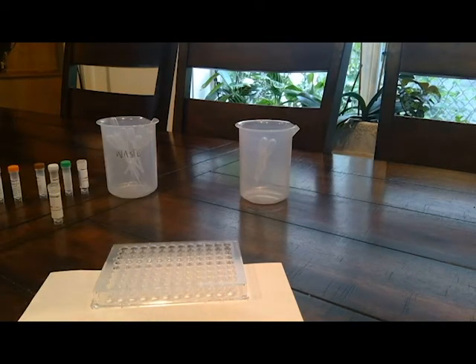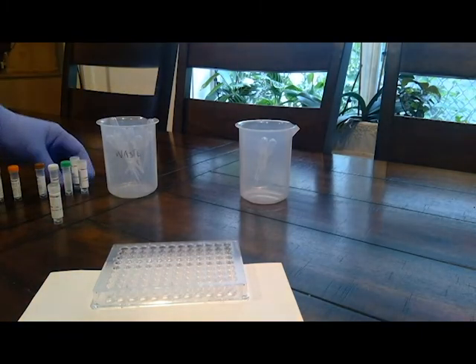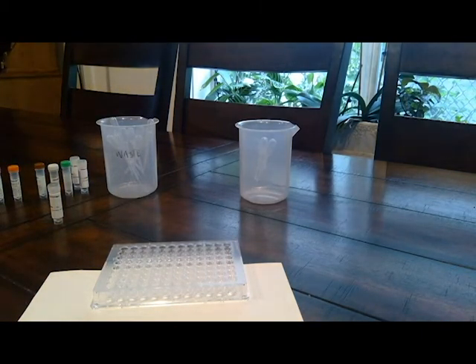Yeah, they didn't seem to give enough to even do it once. Oh no. All right, so we'll just keep going.